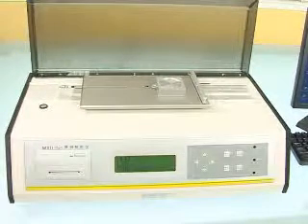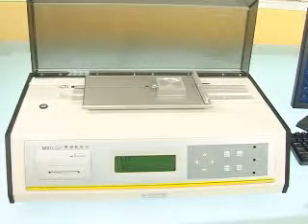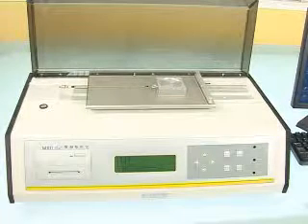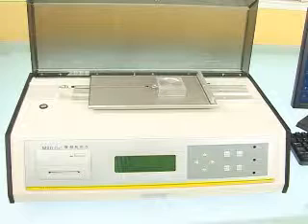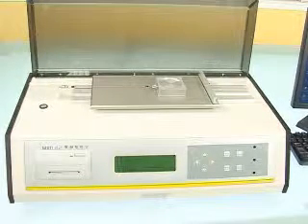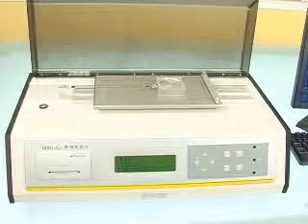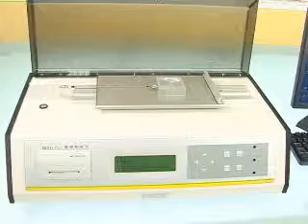Standard communication ports: RS-232, enabling communication with a computer. Professional software supports original data re-analyzing, repeat analyzing, and printing batches of curves in one graph. Test reports can be saved in formats such as Excel, HTML, and so on.